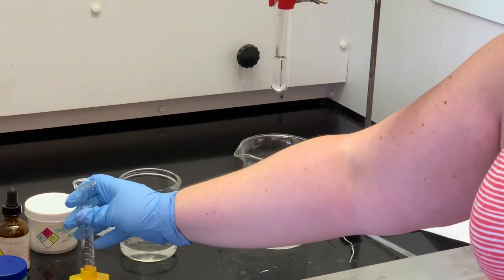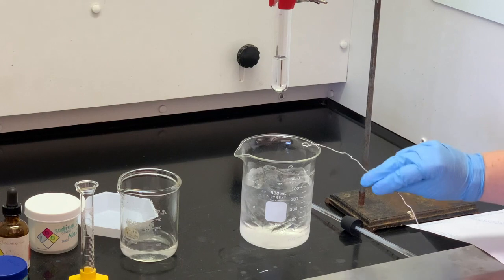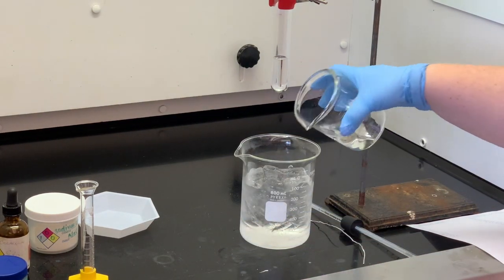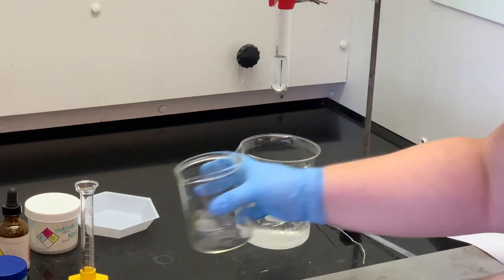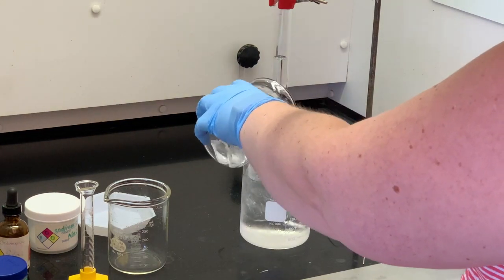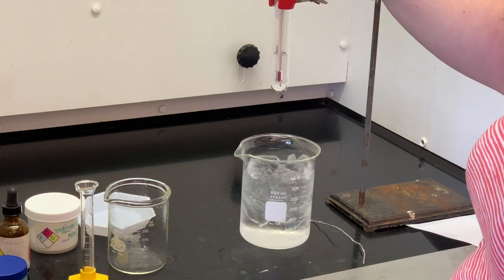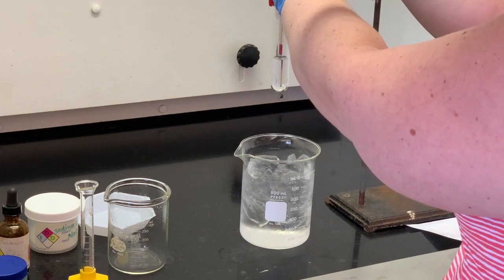I'll fit a thermometer in there as well as this little stirring wire so you can stir it up to make sure all of the solvent is well mixed. I'm going to put the rest of the water in there and may also add a few more ice cubes to make sure the ice bath stays cold enough. I'm going to fit my thermometer into that solution along with the stirrer, and then we'll just wait for that to freeze.